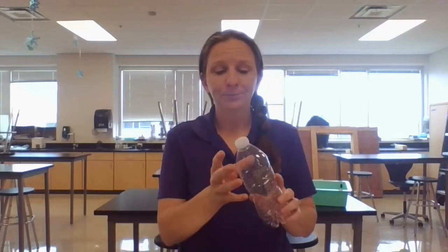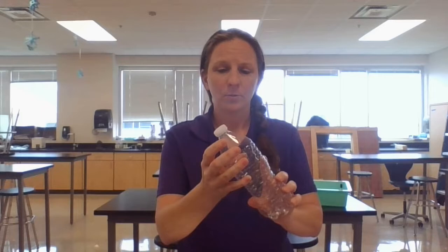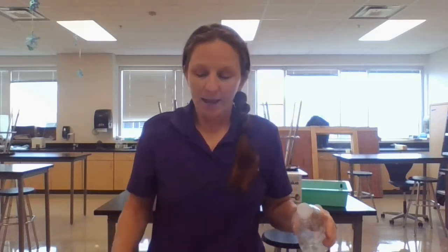So I'm going to use a plastic water bottle. First we're going to create the evidence, which makes it so that when you're practicing, you can have a decent amount of evidence to get your fingerprints off of. To make fingerprints, it helps to get your finger a little bit oily — your forehead, side of your nose, or chin tends to have a lot of oils. I'm just going to gently place my finger on this water bottle to create a fingerprint. That's a latent print — latent means it's 2D but generally invisible. So I'm going to use my magnetic powder to develop this print, meaning we're processing it to make it more visible. We can then lift the print or photograph it to send off for analysis.